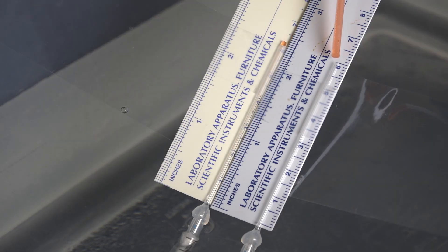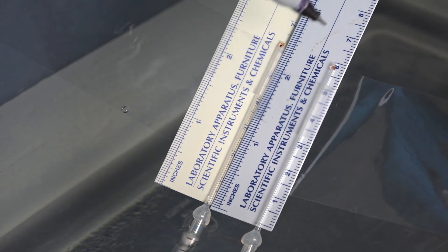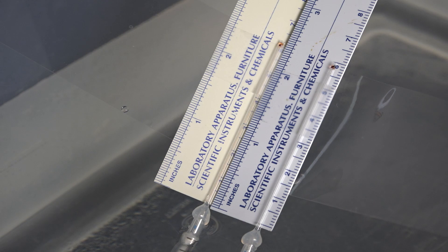After waiting 5 minutes for the temperature to equalize, it's time to start measuring the change in gas volume in our syringes! I'll do this by adding a drop of manometer fluid to the tips of the capillary tubes and marking the location of its bottom edge on the tube. As the organisms respire and the gas volume decreases in the syringe, the fluid will get sucked further down the tube.